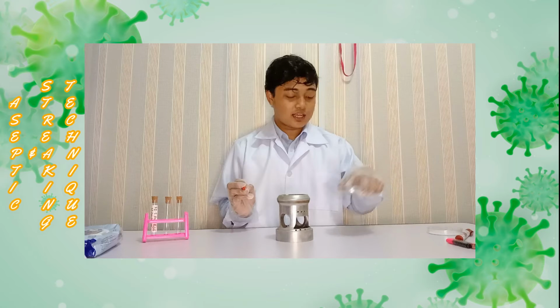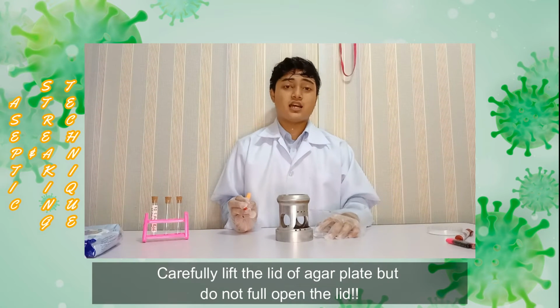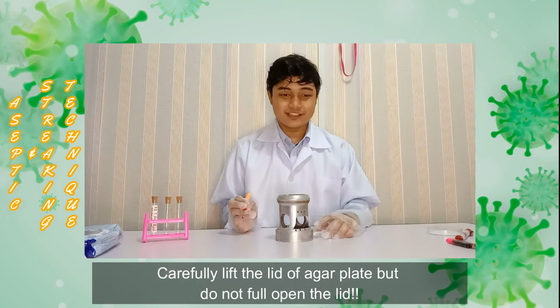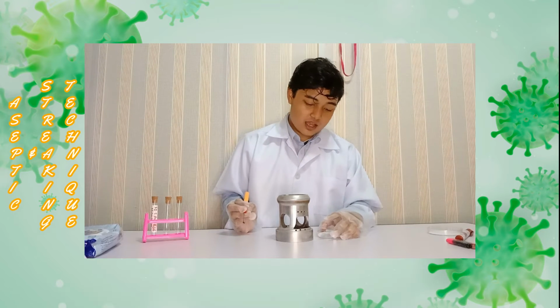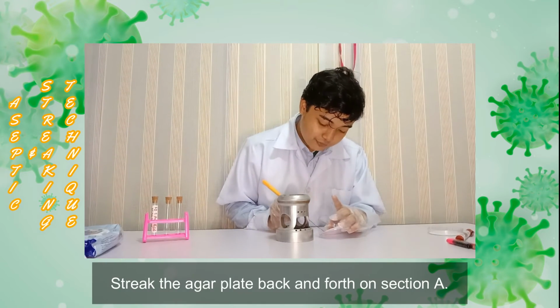For this part we will use a streaking technique on the agar plate we already labeled before. So we take our agar plate, then carefully lift the lid, but make sure not to open it fully, so that the agar plate does not get contaminated by the surrounding area. Then we put our inoculating loop in and carefully streak the loop back and forth.